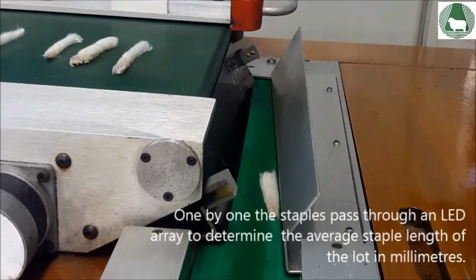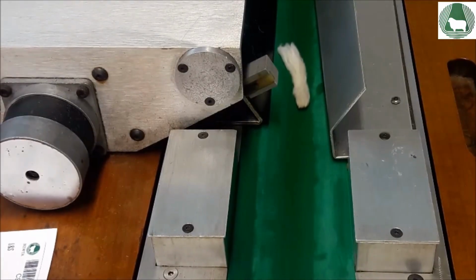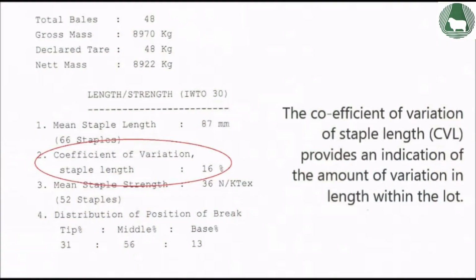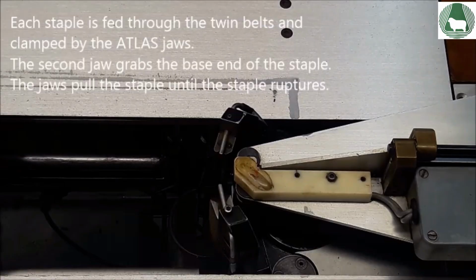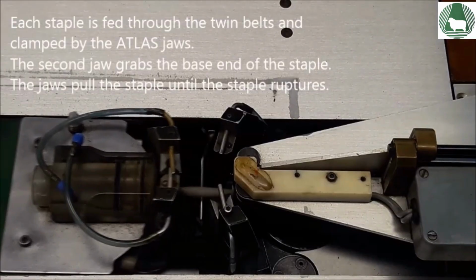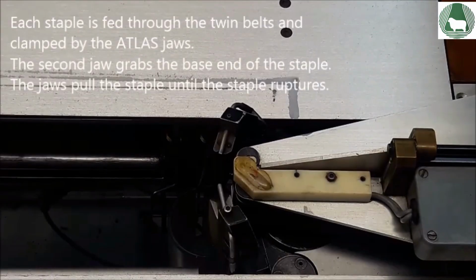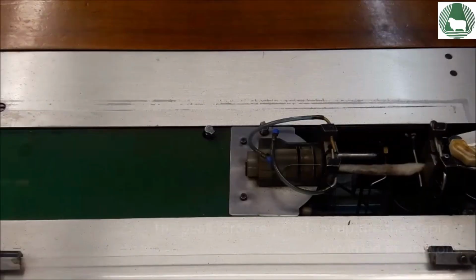One by one, the staples pass through an LED array to determine the average staple length of the lot in millimeters. The coefficient of variation of staple length provides an indication of the amount of variation in length within the lot. Each staple is fed through the twin belts and clamped by the Atlas jaws 10 mm in from the tip of the staple. The second jaw grabs the base end of the staple. The jaws pull the staple until the staple ruptures, and the peak force required to rupture the staple is recorded in newtons.